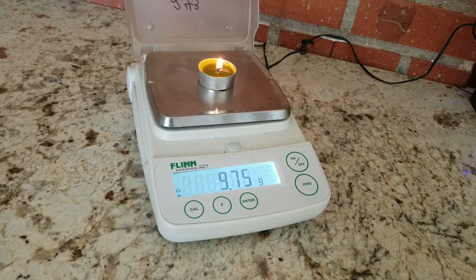.75. That's our 60-second mark. .74. That is our 90-second mark. .73.